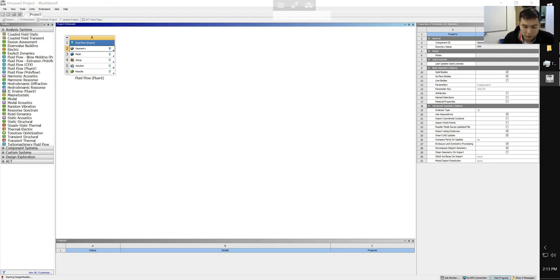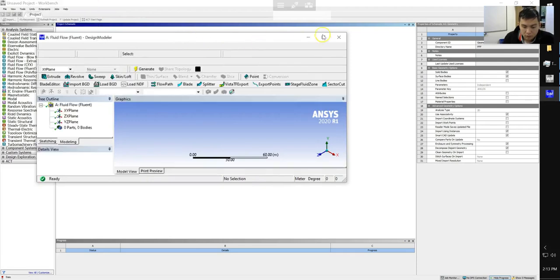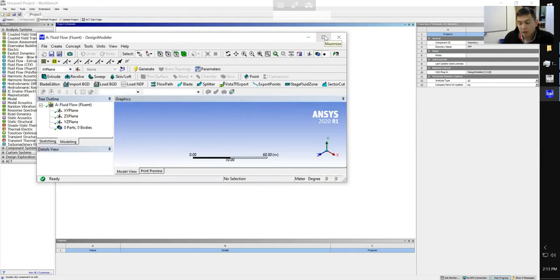So for reference, we're going to be building a microfluidic device that has 3 inlets and 1 outlet. Two inlets will be injecting water. The other inlet will be injecting oil that will form oil droplets inside our microfluidic channel.